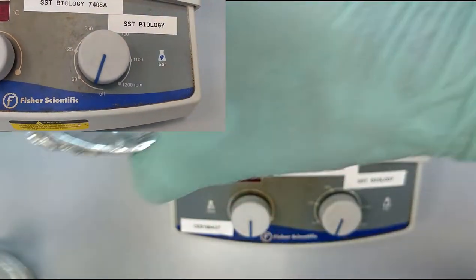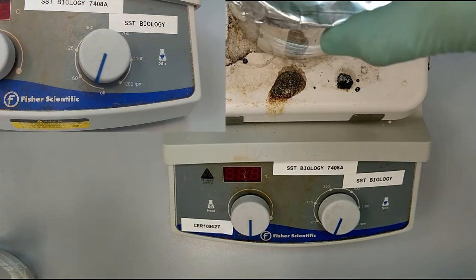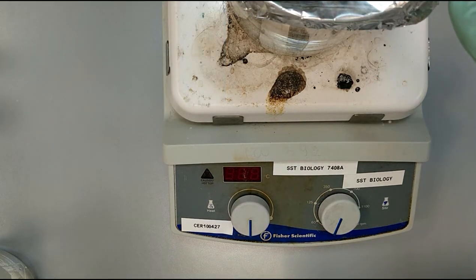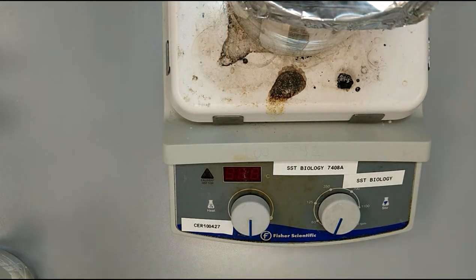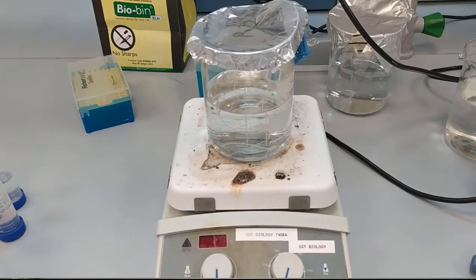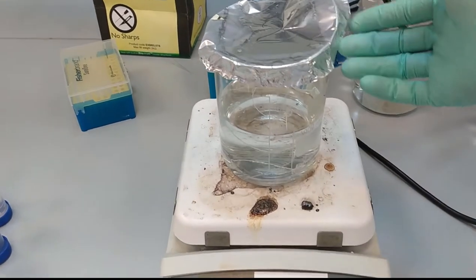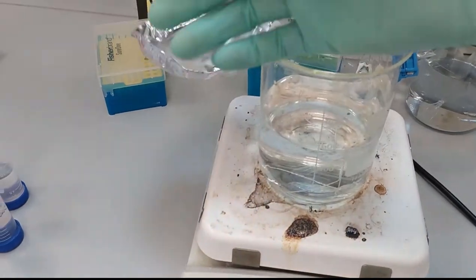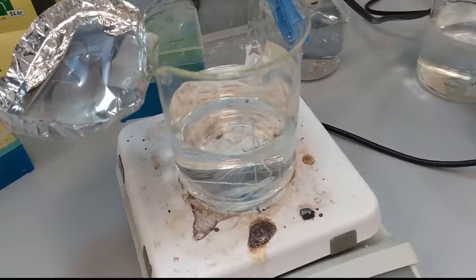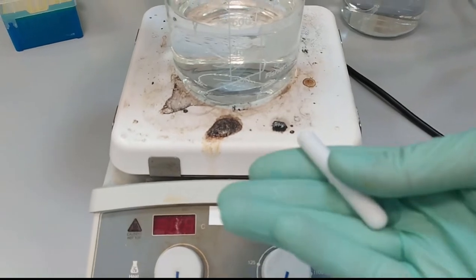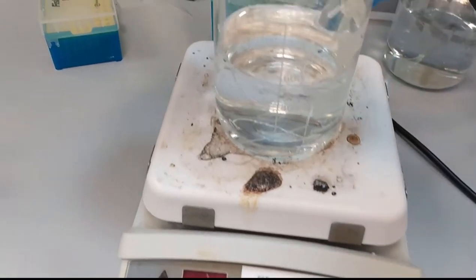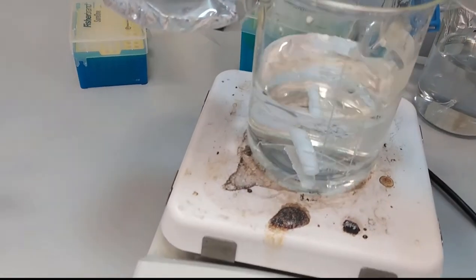So let's say we put the second solution - here you can see that we put the second solution on top of it. What we do next, we place the magnets like this and put it inside the beaker with water.